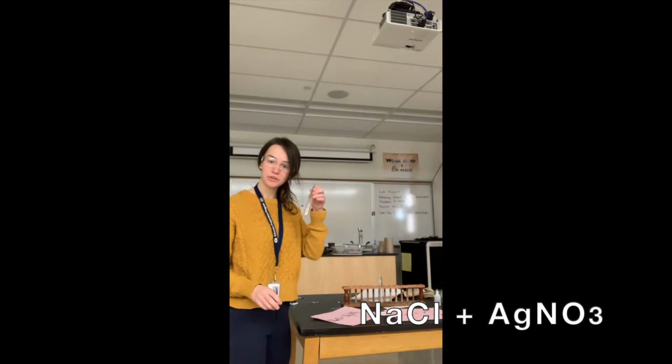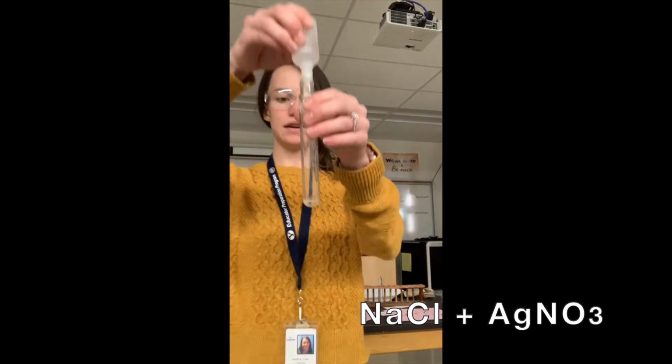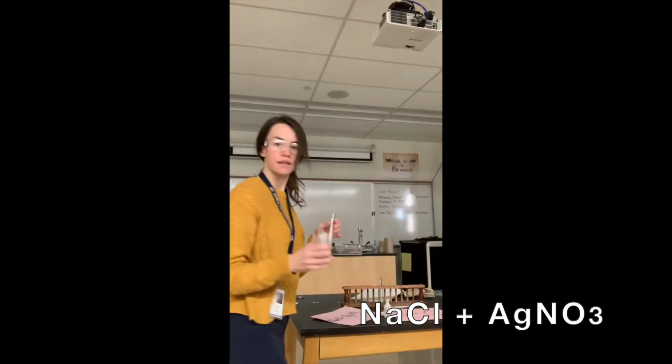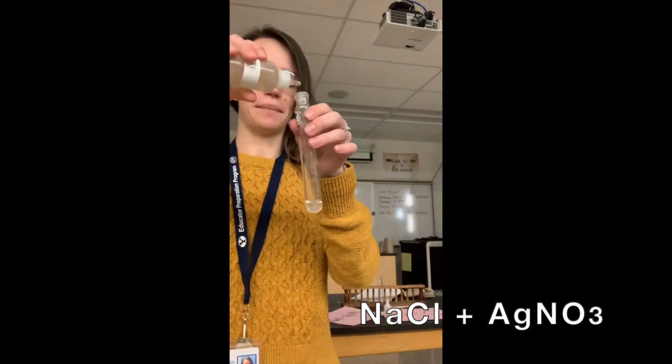So I'm going to have a test tube here. I'm going to have some NaCl I'm going to put inside. Okay, you can kind of see it's just that clear liquid. Then I'm going to have some of this AgNO3 that I'm going to dump inside and we'll see what happens.